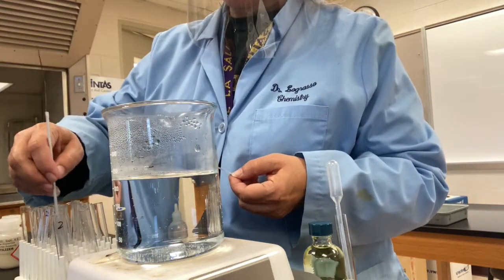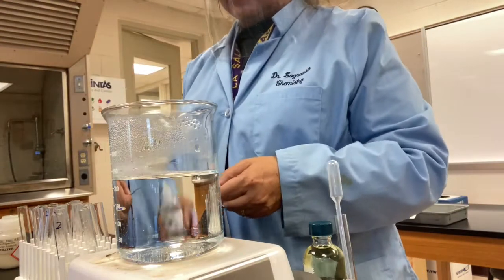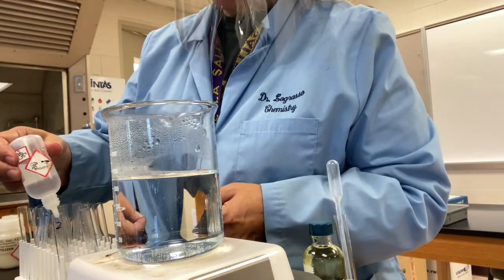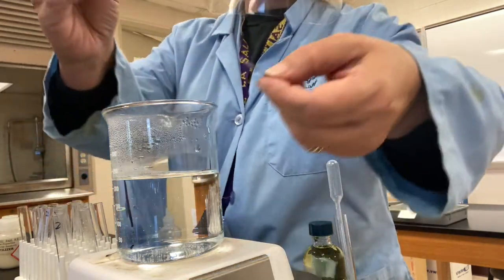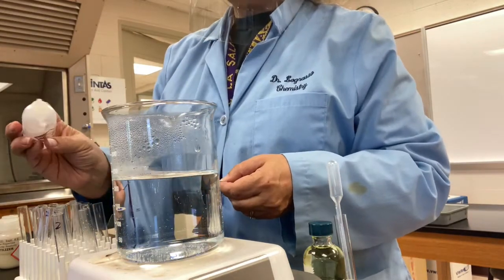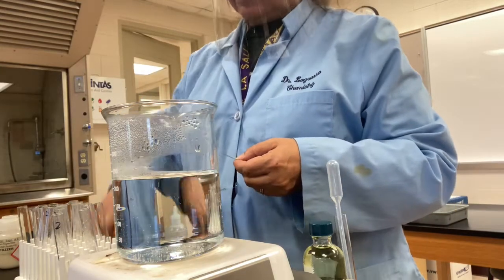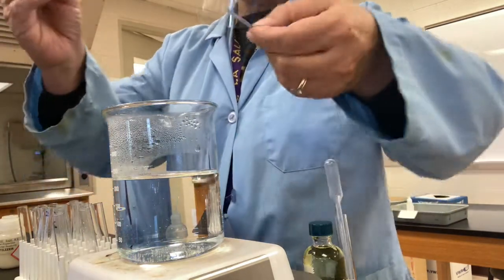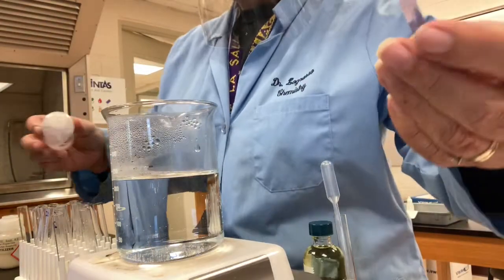Stir it and see if it turns acidic. Nope, I got to be a little bit more aggressive. Add a few more drops of nitric. It needs to be acidic. Nope, more aggressive even than that. Okay, we'll keep going here. More nitric. Stir it up. And just getting there. See how it's turning just mildly red? I'm going to add one more drop and see what happens.